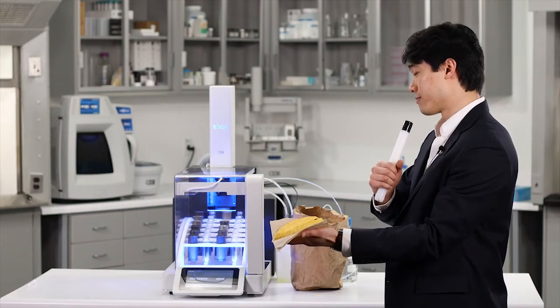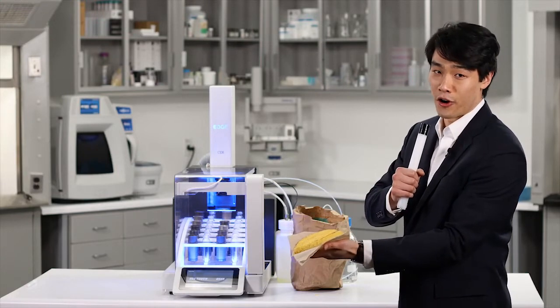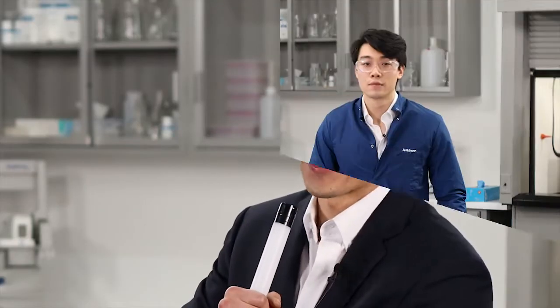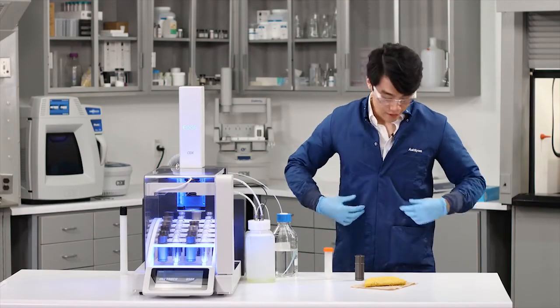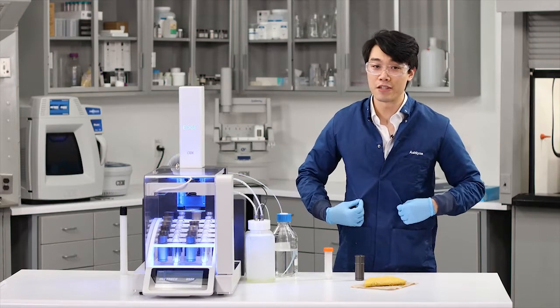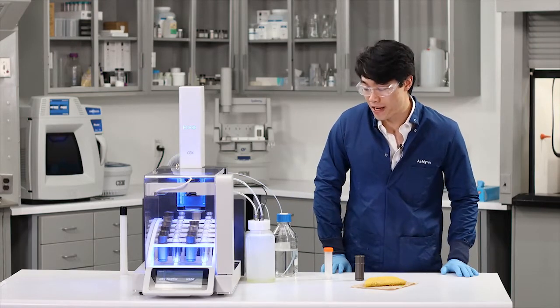But now it's time for the part of the show that everyone loves: sample prep. And through the magic of television, I'm standing here in my PPE gear. Now let's get that sample prepped, Edge.